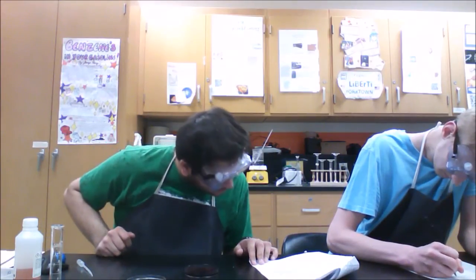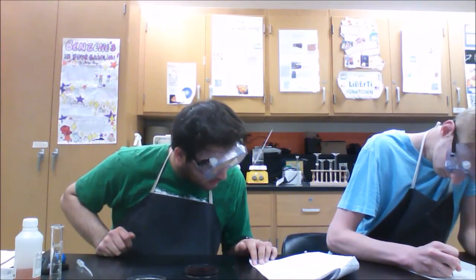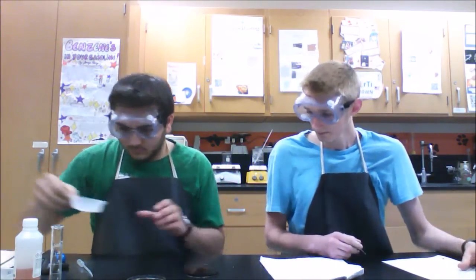Next, the procedure calls for half a pea-sized amount of potassium nitrate crystals in one spot. Your potassium nitrate crystals are the same white color. Add them to one spot. Initially there's no effect, but the procedure says to wait 30 seconds. After 30 seconds, the crystals slowly spread out throughout the solution, and the solution gets a little clearer. Now keep your lid back on and swirl it.